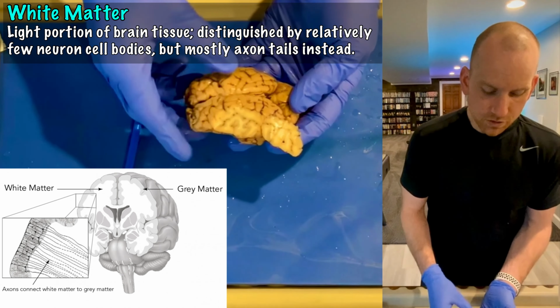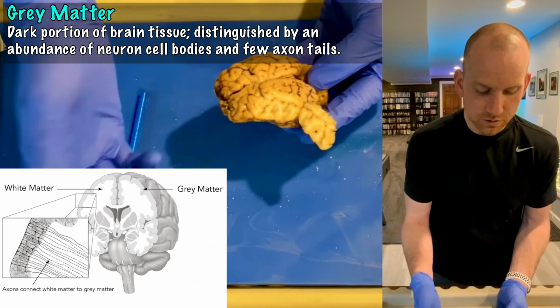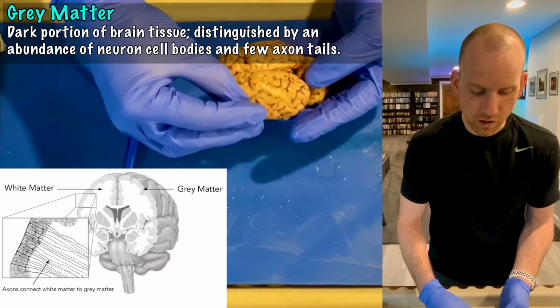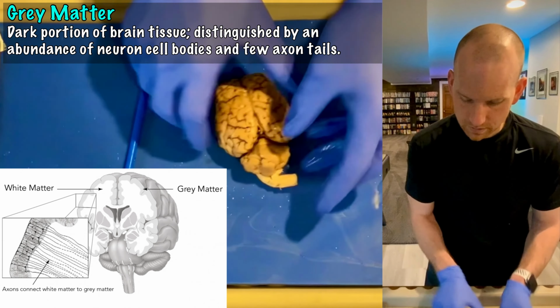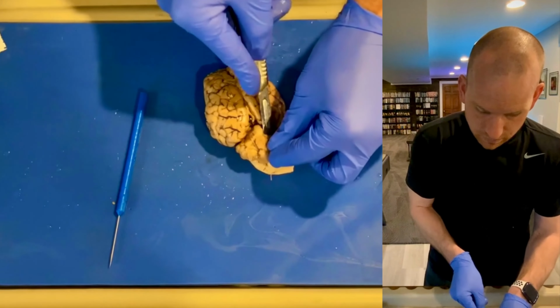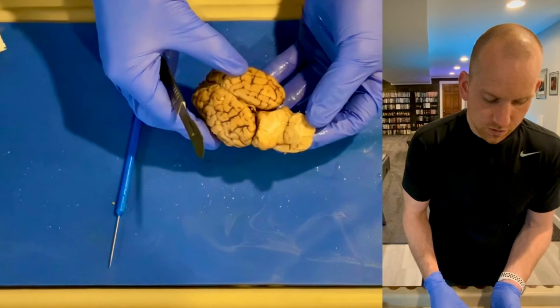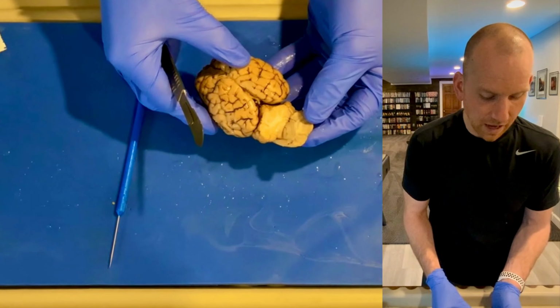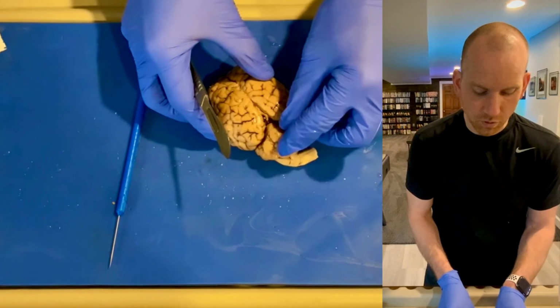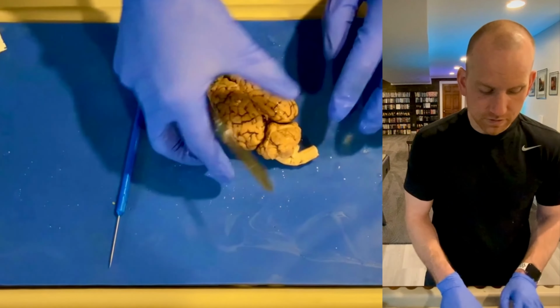And the reason we have white and gray matter is something I'm going to get into, and I'll probably try to shoot that video in here as well. I'll try to draw that for you. Right here, we also have white and gray matter of the cerebellum. And you'll be able to see that too when I cut the brain in half, that there's light and dark sections of both the cerebrum and the cerebellum.